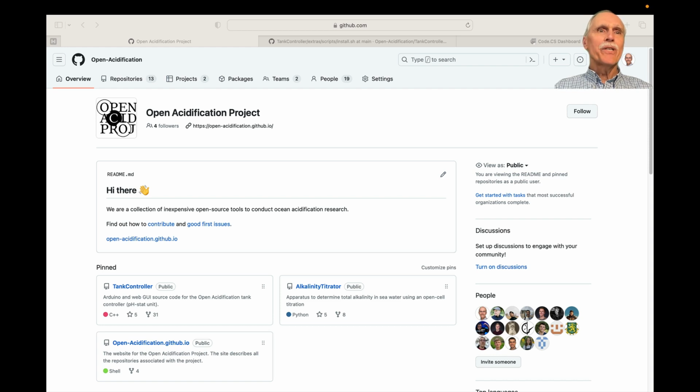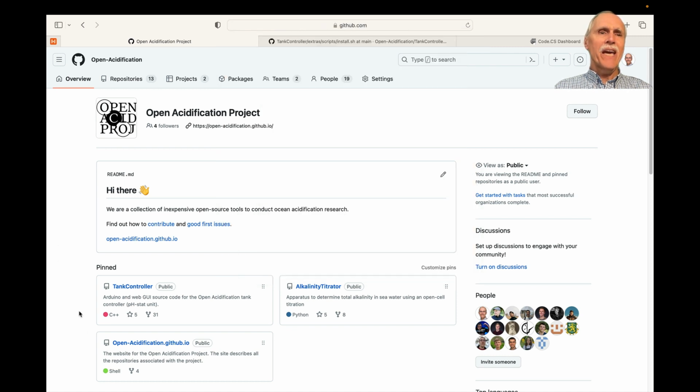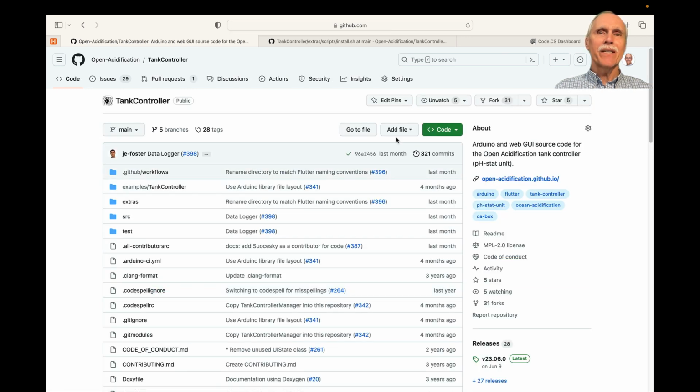In this video, we're going to look at how to contribute to the Open Acidification Project, TankController. You can find this on github.com/open-acidification, and then we'll go select the TankController project.